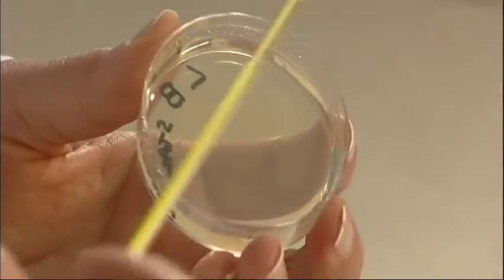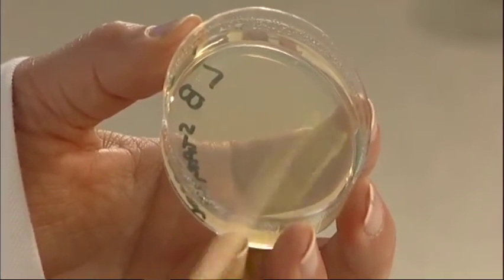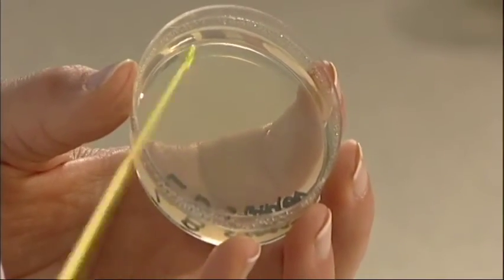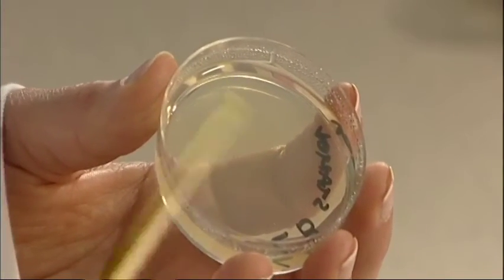Give the plate a quarter turn and draw ten lines starting from where you left off. Give the plate another quarter turn and repeat. Finally, give the plate one last quarter turn and draw another ten lines.